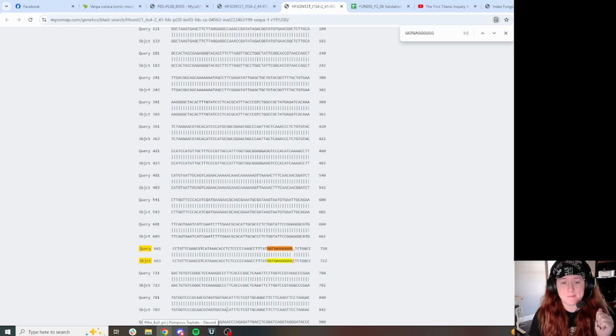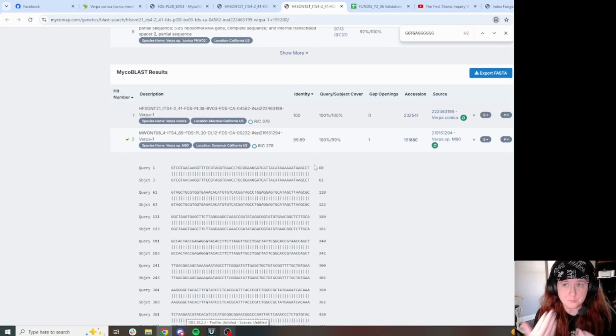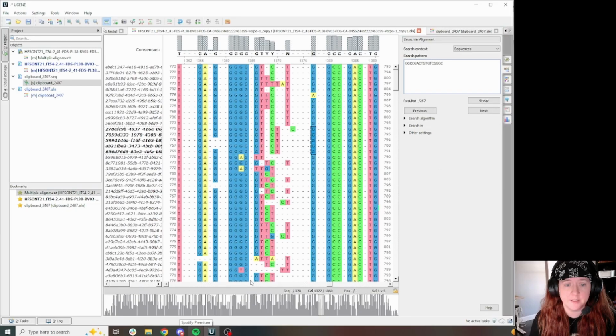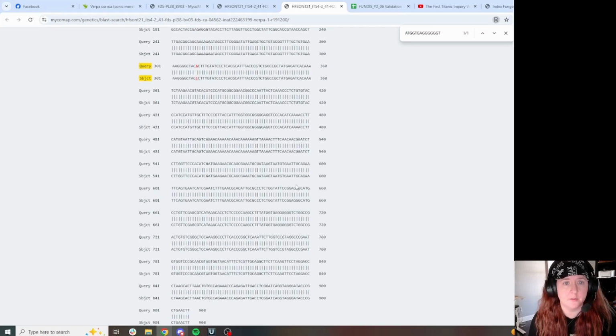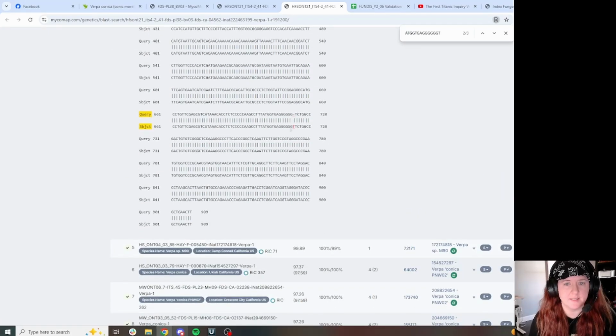The other thing I wanted to show you with this is my BLAST for the alignment. I just pulled this little region right ahead of where this problem area is and searched it in just the closest match. And you notice in the subject, so query is my sequence up here, like the initial one that was spit out by NG species ID, and it's missing a T. My subject has a T in this position, right? So let's check another one. Okay, this one does not have that extra T in this position. This one does have that extra T in this position.